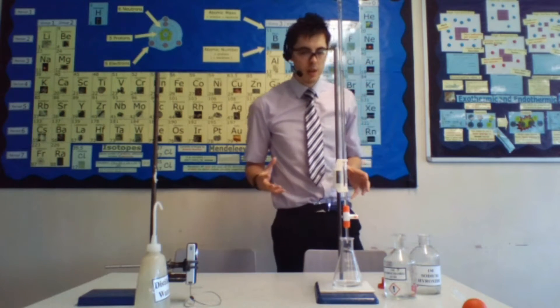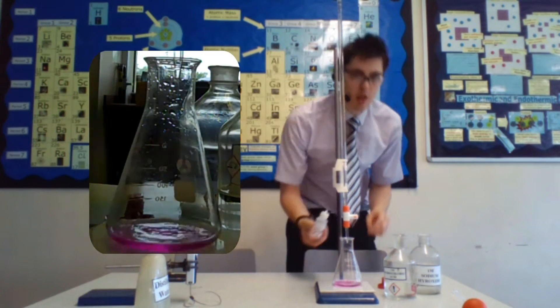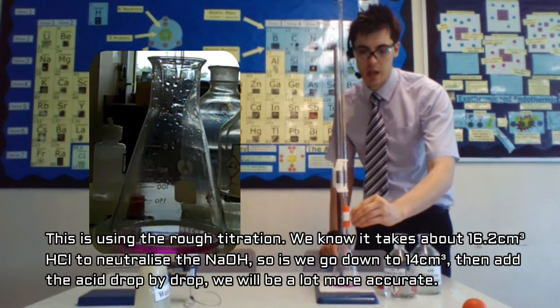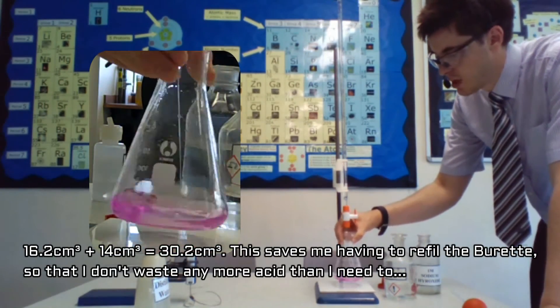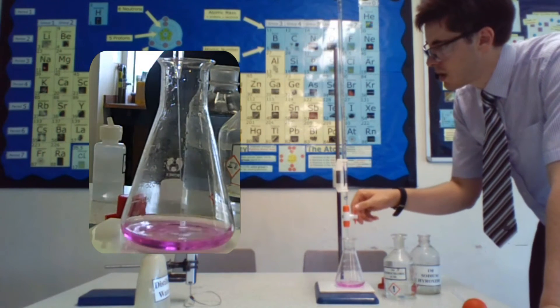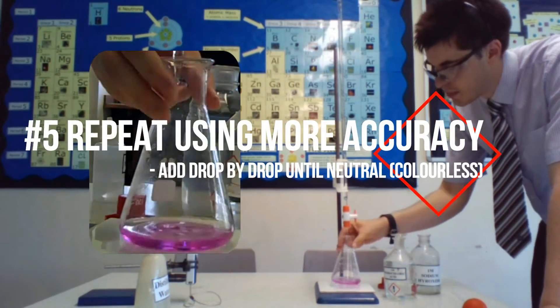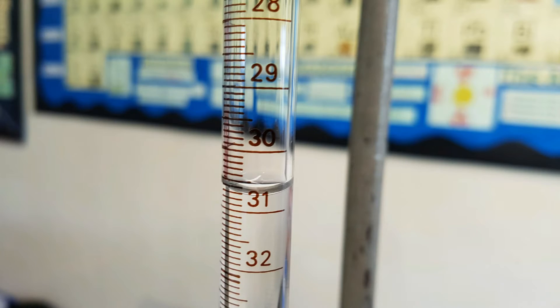Now that you've done that, the next step is to do the same experiment again. Put in your indicator solution, but this time go down to just below the endpoint — so instead of going to 16, go down to about 14, meaning stopping at around 30 on the burette. Keep stirring, and then add it drop by drop until it goes completely colourless, which happened at 30.8.